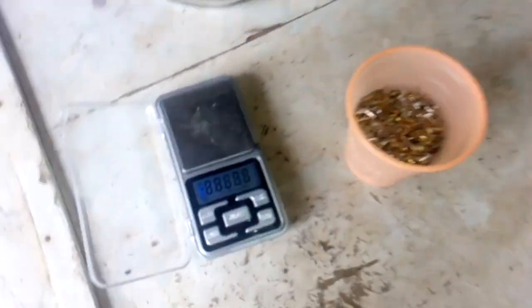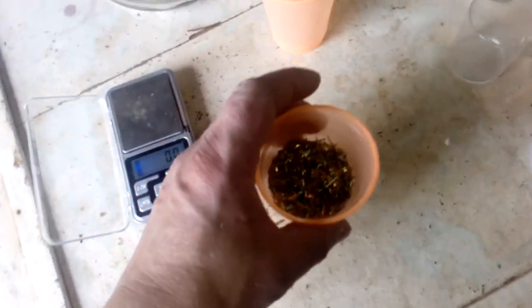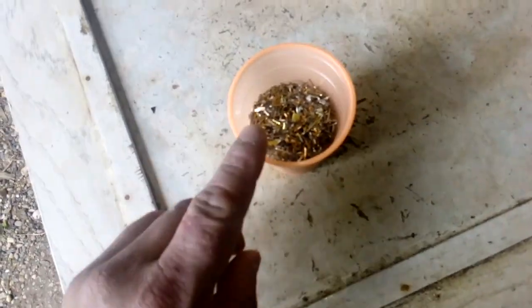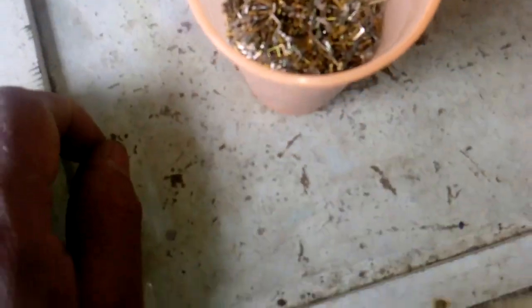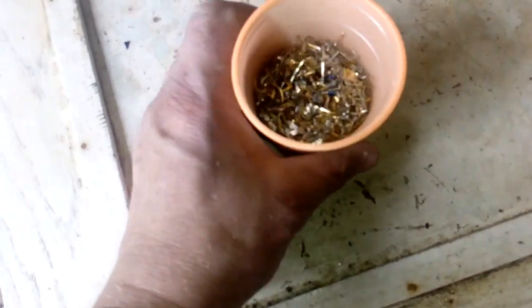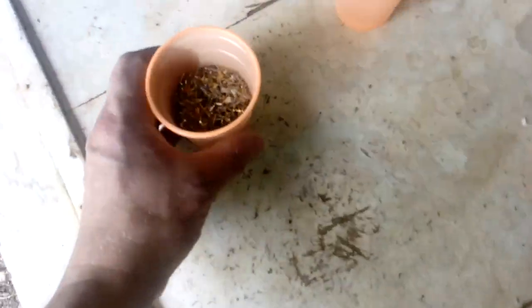Here we got about 2.5 — so we got 160 grams of pins. Pretty cool. These are pins from the motherboard but not from the slot card jacks; these are from video output and USB and different stuff. We also got some from hard drives and a lot of pins from laptops, some receivers, and something else.